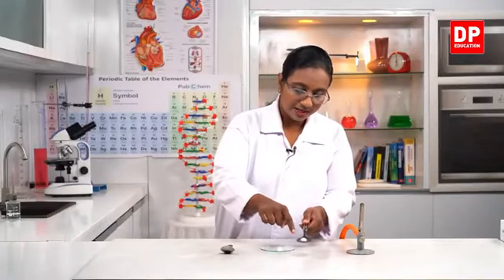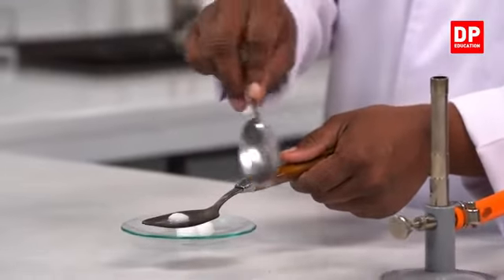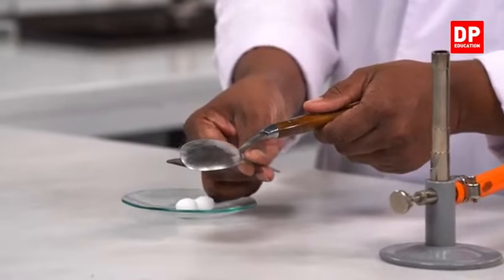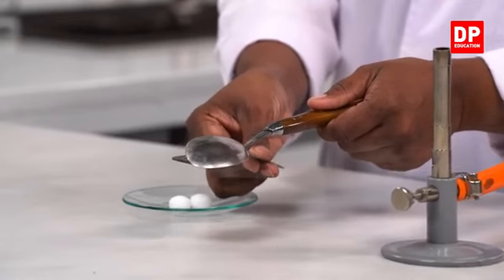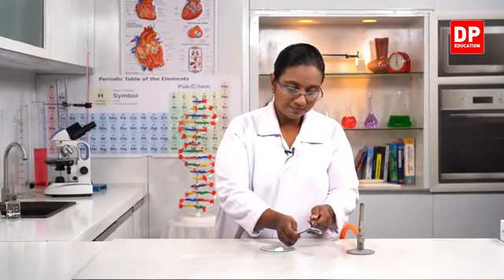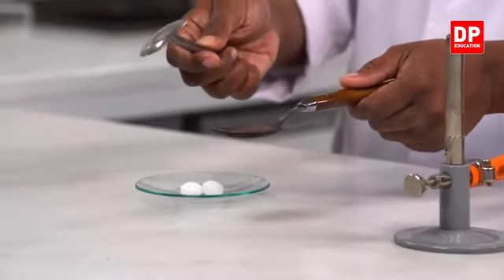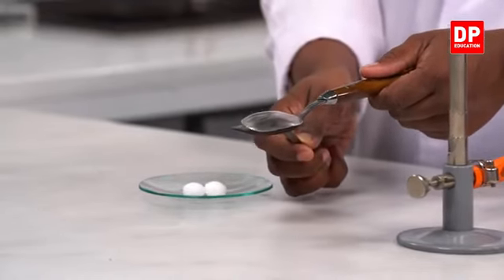Observe it. You can see it becoming a liquid. Can you all see that? And you can see the fumes going off from there. So this is what we need to do. I need to close it with another spoon. So here you all can see it becoming liquid. The solid turning into a liquid. We will have to hold it for some time. Now you all can see now the mothball has almost disappeared. Only the liquid naphthalene is there. So I will hold it like this for some time.